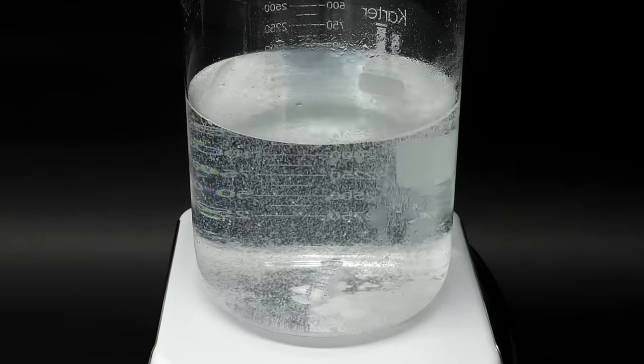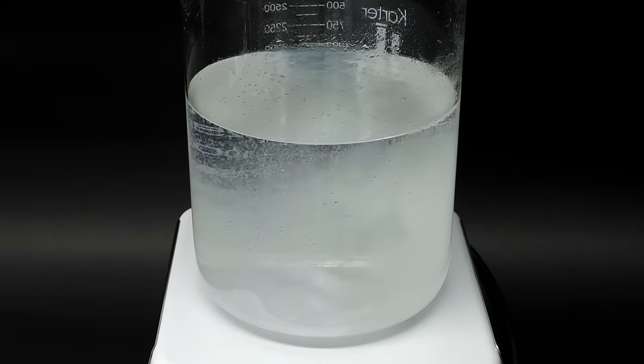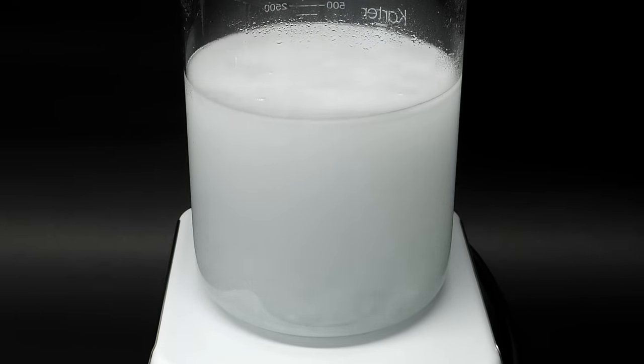Okay, so now, with all the baking soda added, I can turn on the stirring. I'll also turn on the hot plate, and I'll heat this whole thing up until it's almost boiling.